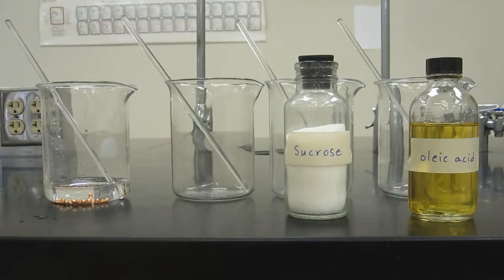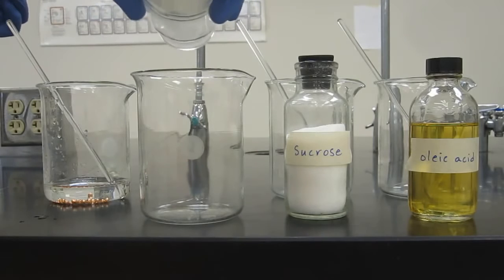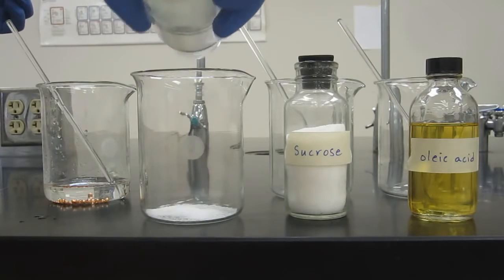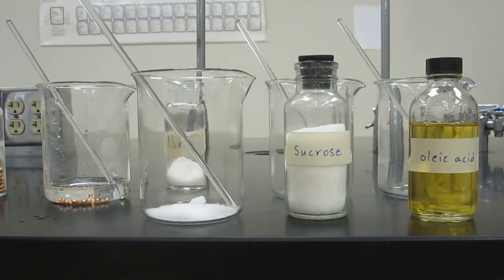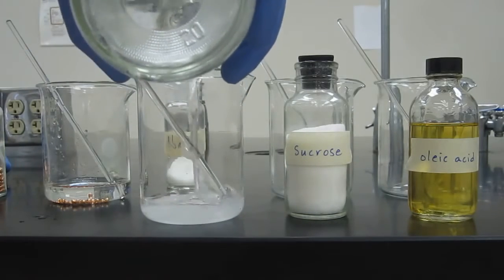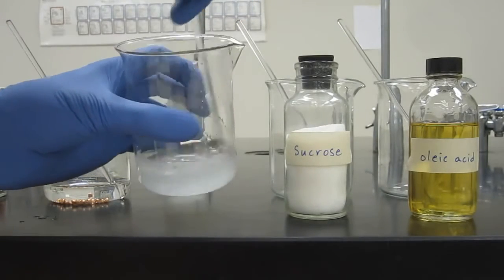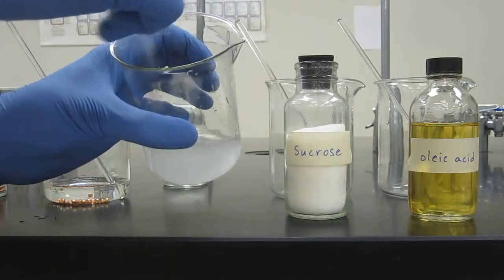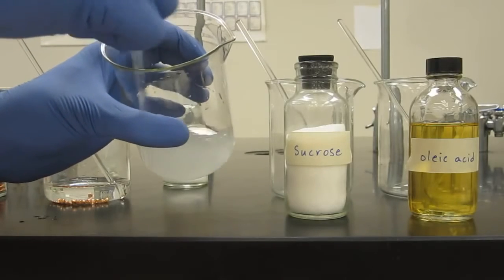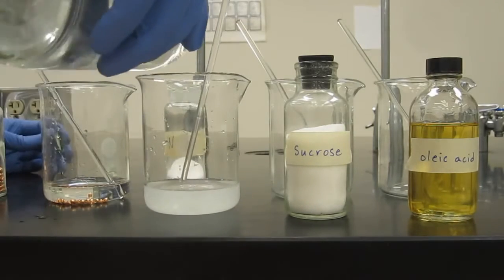Let's do the same thing with sodium chloride and water. Let's pour a little bit of the sodium chloride. Remember, this is just regular table salt. This is actually pure stuff that I got from the chemical company. Pour a little bit of water in there, and then we'll mix it up. You probably know what's going to happen from doing this in your daily life. Put some more water in there.